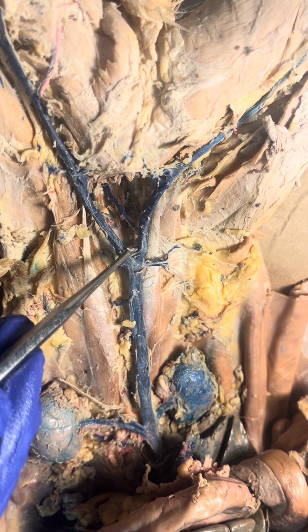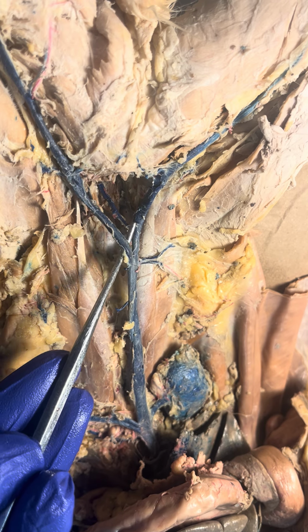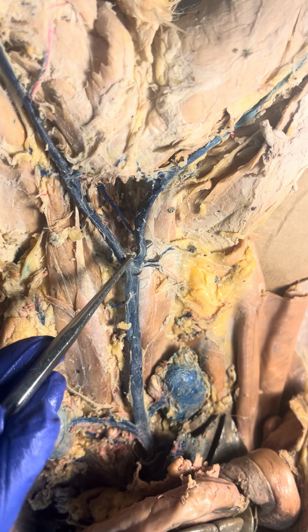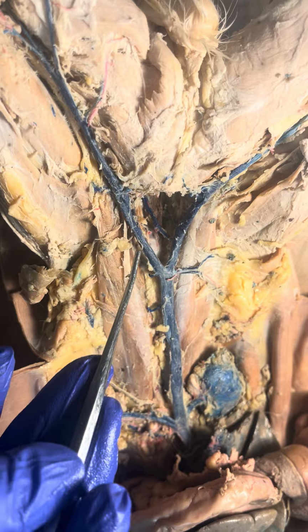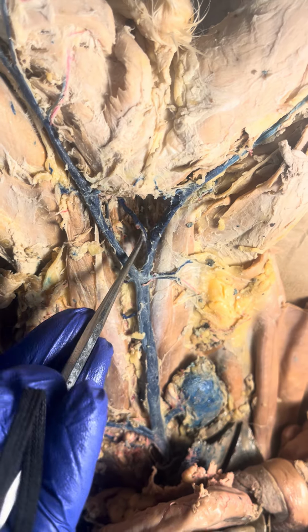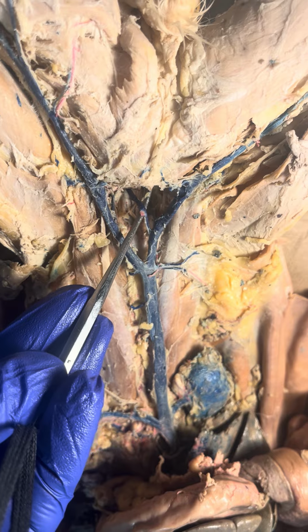And now, this is always called the inferior vena cava, and now it splits into two. And after this split, each one of these are called the common iliac veins. So I have a left common iliac and a right common iliac. So now this is different from the arteries. We don't have common iliac arteries. Humans do, but cats do not. And then coming off quickly, a small vein going down deep, and this is the internal iliac.